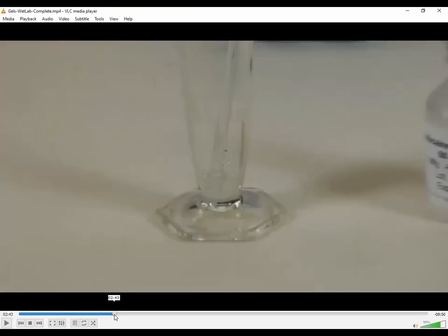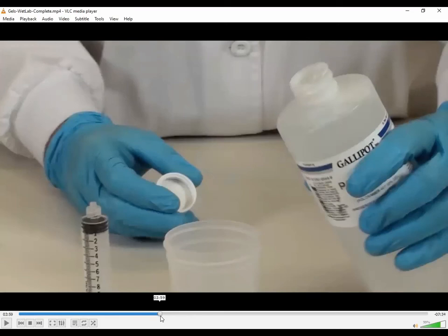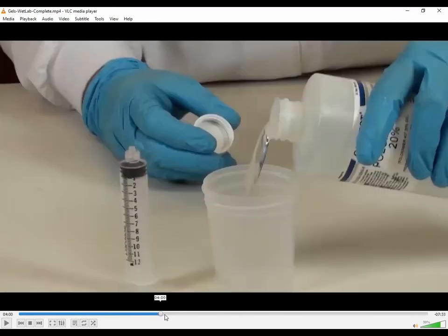Okay, and eventually it will dissolve, as you can see, and be in there. All right, so I'll skip this step for now. While it's dissolving, you're going to go get your Poloxamer. That's the clear. Remember, Poloxamer is the gelling agent. It's the hydrogel, the water alcohol mixture with the gelling agent.